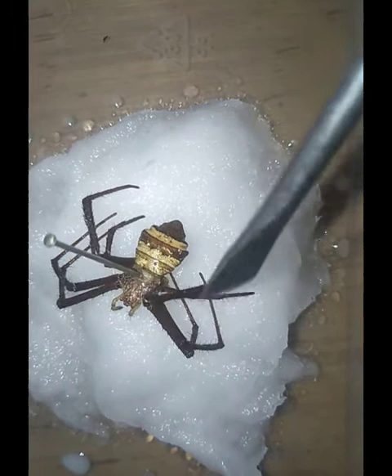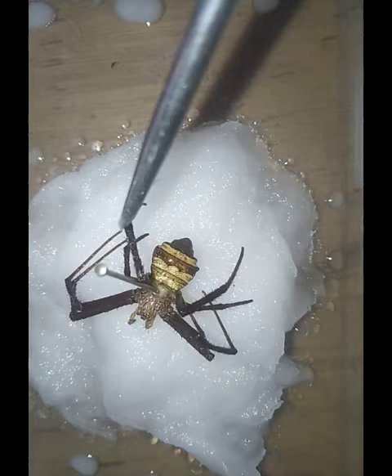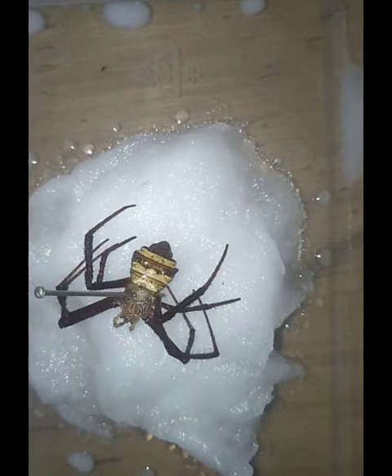Let's tackle the thorax. The thorax has four pairs of legs: one, two, three, and four — overall it has eight legs. This is the abdomen. That's the external feature of a spider and the end of the whole demonstration.